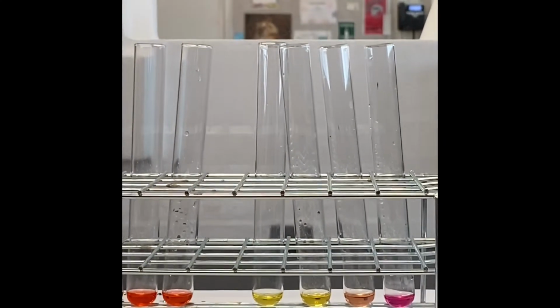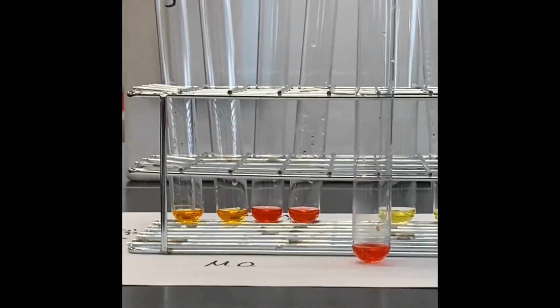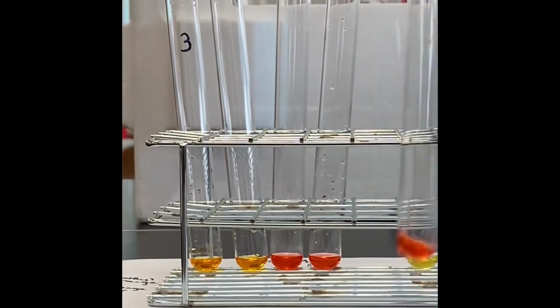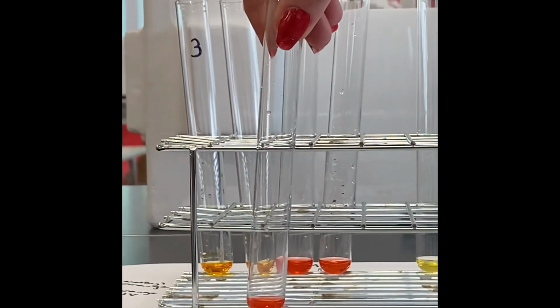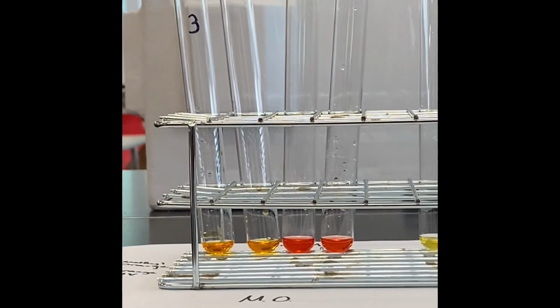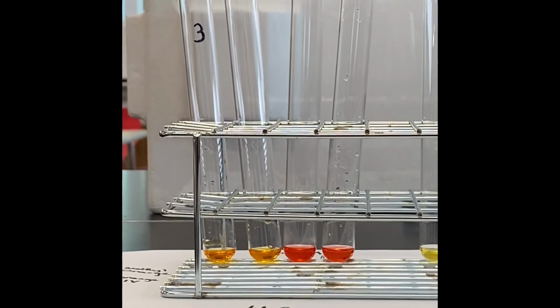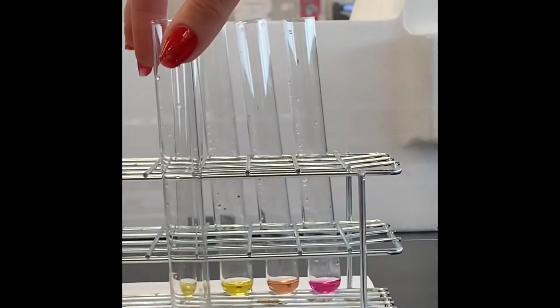So then we're going to be quiet and let you guys decide what the rest of the colors are. All right. This is methyl orange, 1 molar acetic acid. Let's put it back there a little bit longer. Let's make sure they get a chance to compare. So you're comparing it to the 4 on the left. Where do you think it falls in terms of color? Remember that the concentrations are going from 0.0001 to 0.1. And this is acetic acid, 1 molar with orange 4.